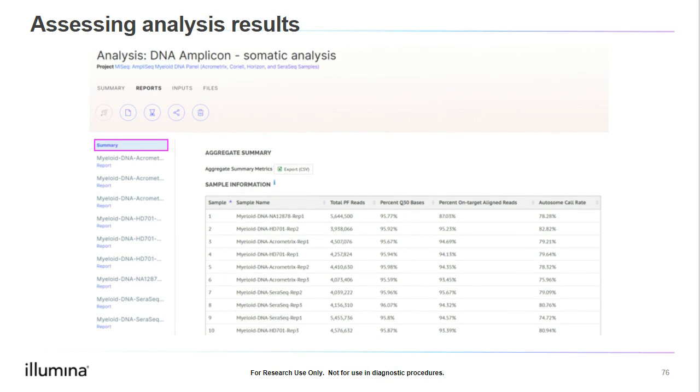First, when you open the analysis, you will see a summary of the analysis results. These are high-level and list the results for all of the samples included in the analysis session. You can also review summaries on a per-sample basis, though here I will review the summary results for all of the samples. This is a quick way to evaluate many of the metrics for all of the samples analyzed and helps us to compare the performance of the different samples with each other.